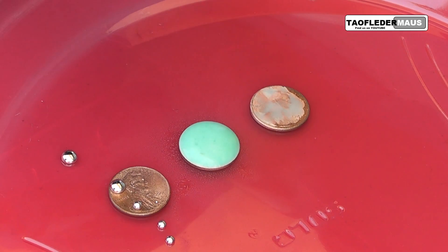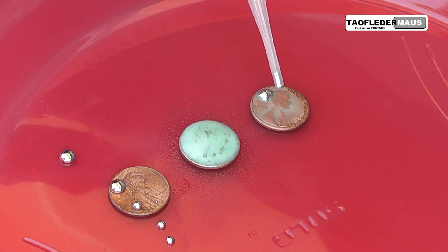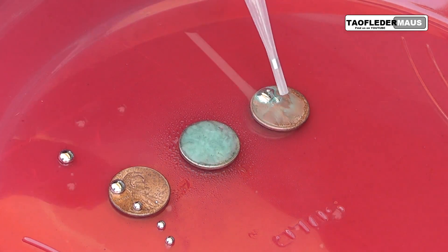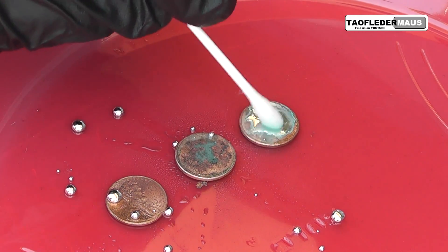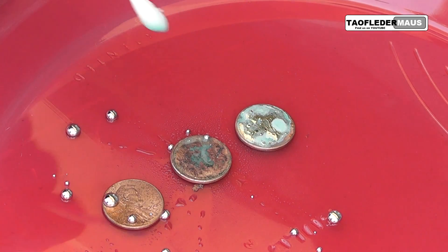And this is very similar to soldering — that's how we pronounce it here. You'll see how the mercury now can actually combine and bond to the copper. This is all taking place at just room temperature on a warm day actually — we're not adding extra heat or anything, though heating up would speed up the process a little bit. We'll swab it around a little bit, clean a little more of the oxidation off, and we can just completely coat that penny with the mercury.